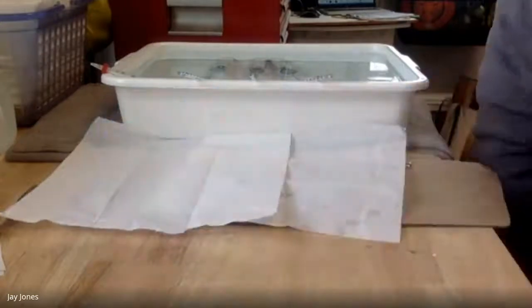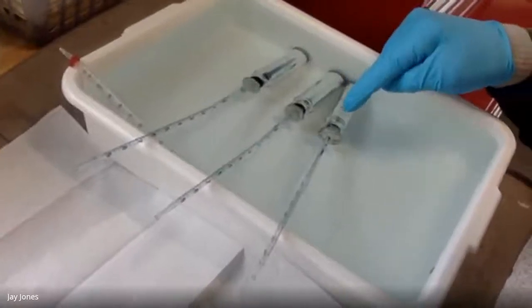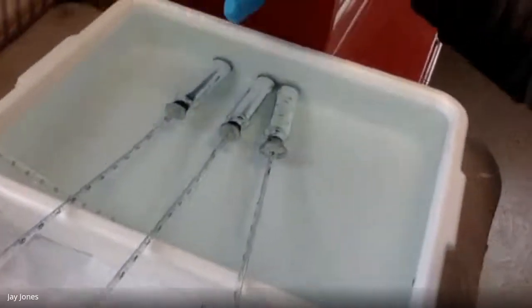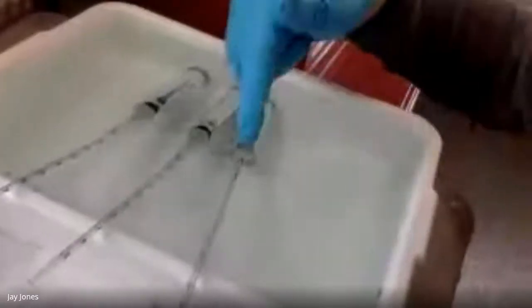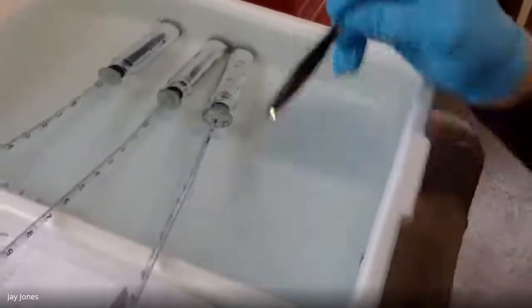For another 2 minutes, I'm going to let everything in here equilibrate in temperature. I'm letting the glass, the rubber, the metal, the peas, the beads, the cotton, the KOH, all get to 10 C, because what we're measuring here is the changes in gas in this 1 ml pipette.